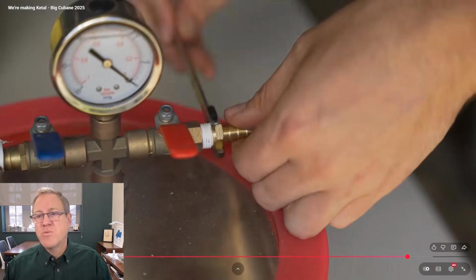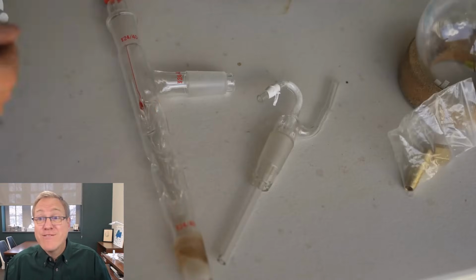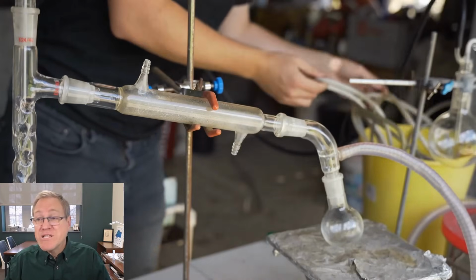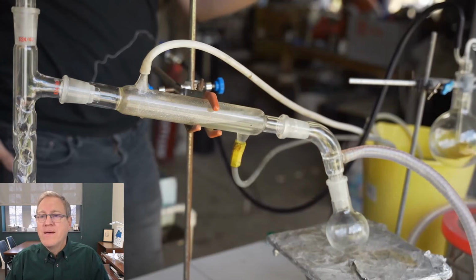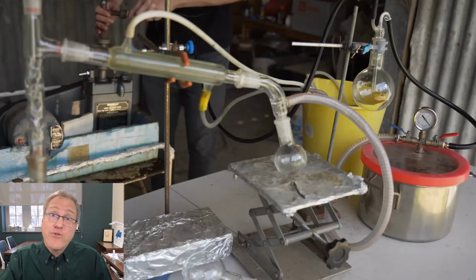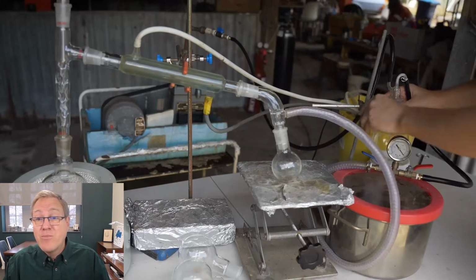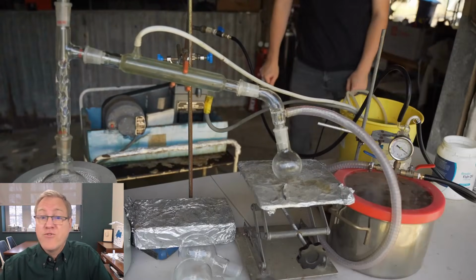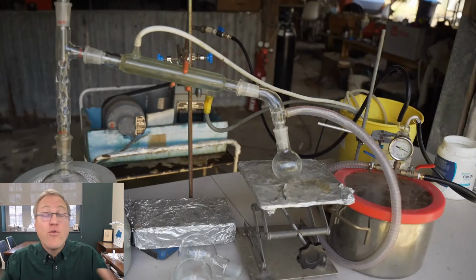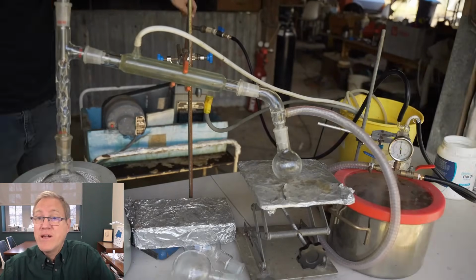Okay, little montage. We'll mute this. He's putting everything together. Note that you can't have air leaks. So he's putting grease on the joints to make sure that they leak as little air as possible into the system. It's a distillation, so he's going to have a condenser. And he's turning on his big vacuum pump. That is a big boy vacuum pump. And he's pulling a vacuum. Everything is hopefully sealed tight. His tubing is airtight, doesn't let any leaks in, and he's running it.